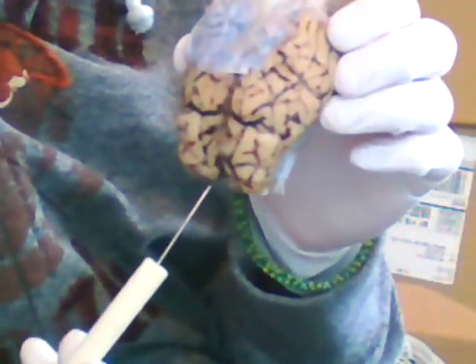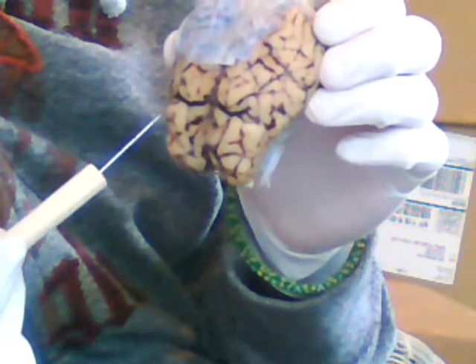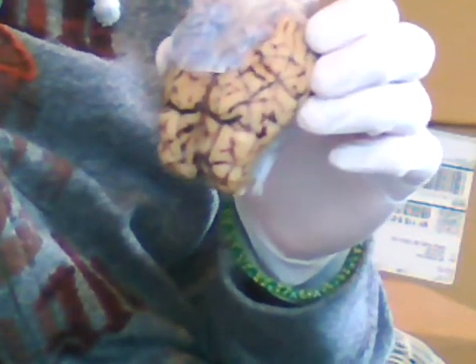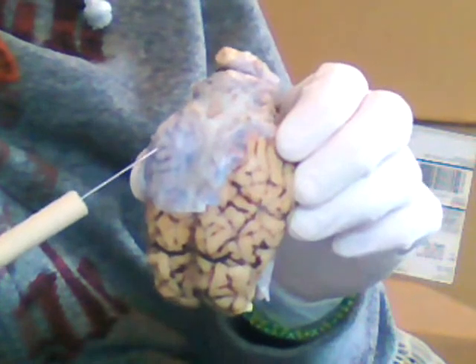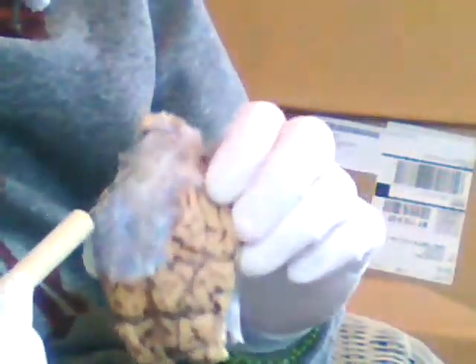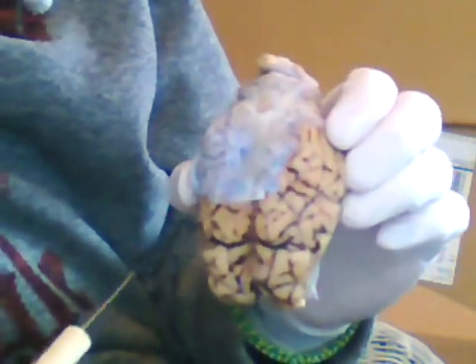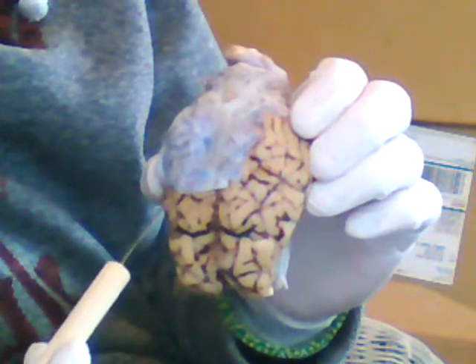Of course, over here we have the frontal lobe, which contains the primary motor cortex and a lot of dopamine sensitive actions go through this part of the brain. Up here, it's under the dura mater. Up here is the parietal lobe, which integrates sensory information, particularly spatial sense and navigation. Flat down the middle, you have the longitudinal fissure, which separates the right and left hemisphere from one another.